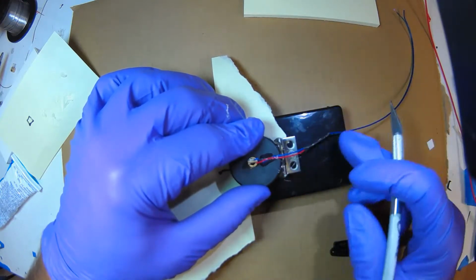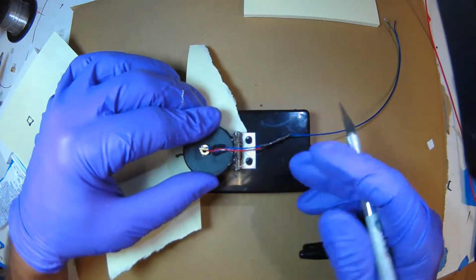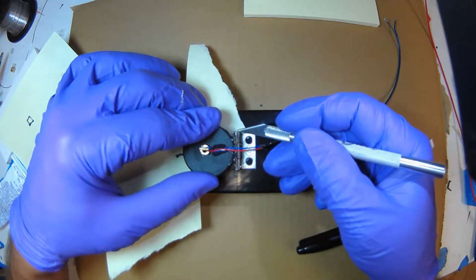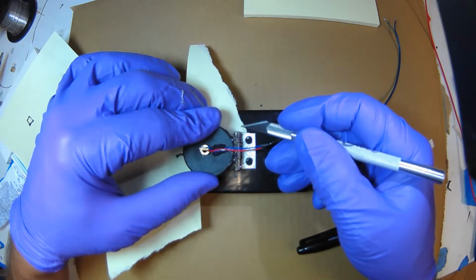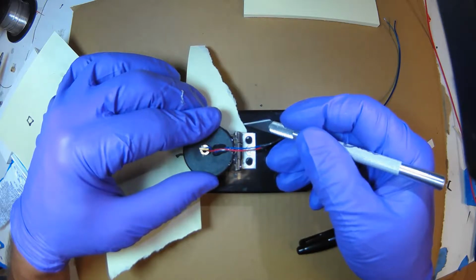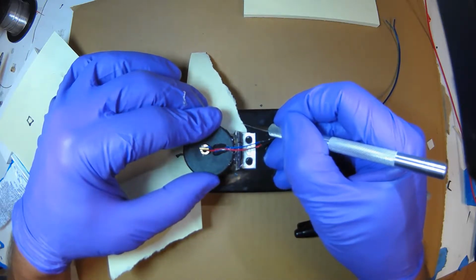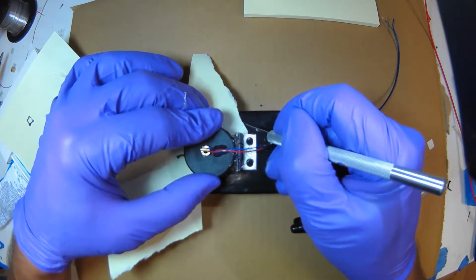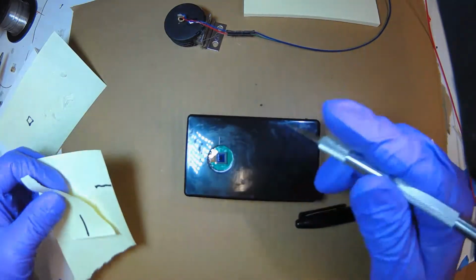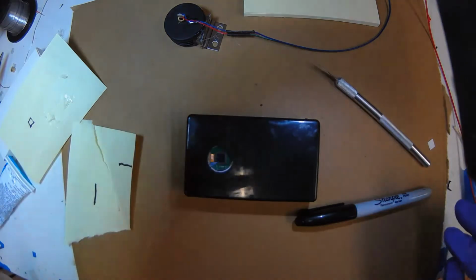is, since the hinge is going to bend, I'm going to lay the wire on the side so the pivot point is here, so I can put the wire, the hole, I'll put it around here, so I'm going to scratch this. Okay, so now I know I'm going to drill my hole there.